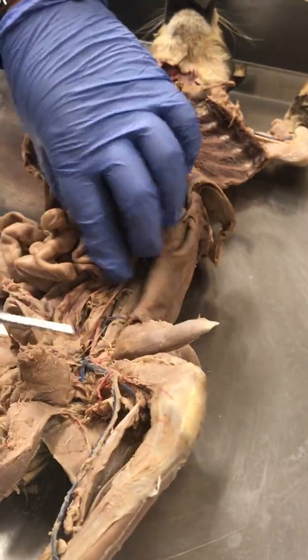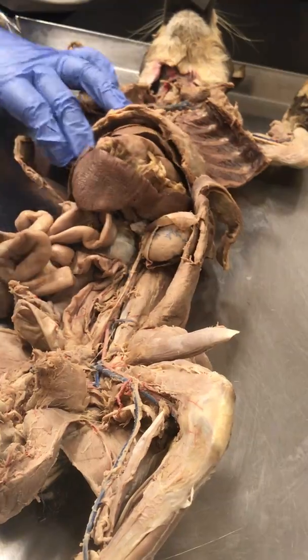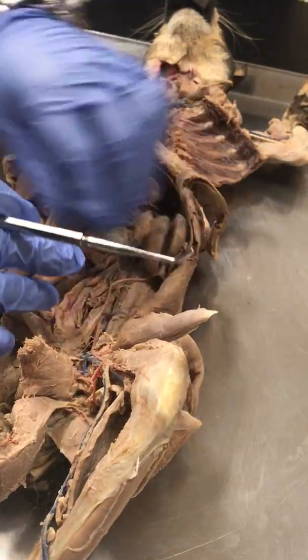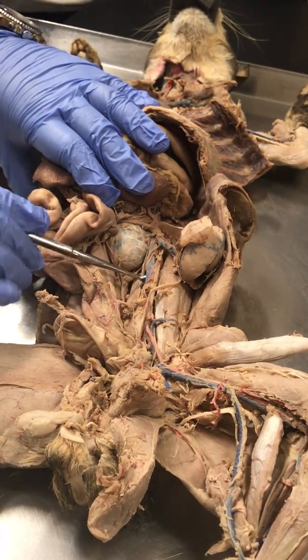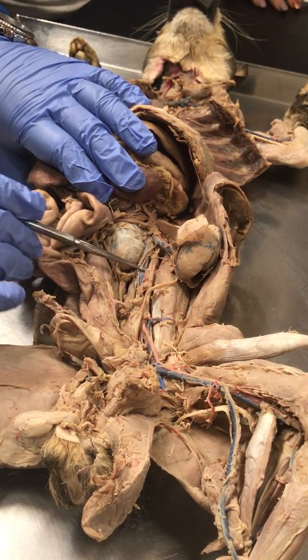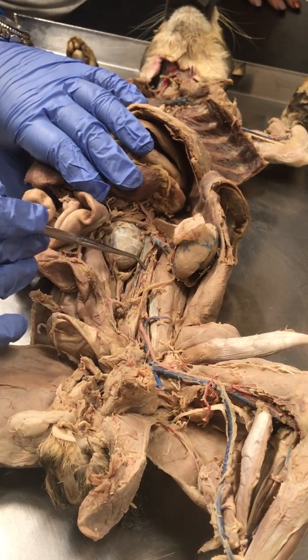Now let's go this way. Now we're in the abdominal region. No need to worry about foregut, midgut, and hindgut stuff. But that was last exam. We want the vasculature. So what we can see on this cat here, obviously, this big vessel here is the inferior vena cava. We also see this vessel that's not too well colored, but it's there.